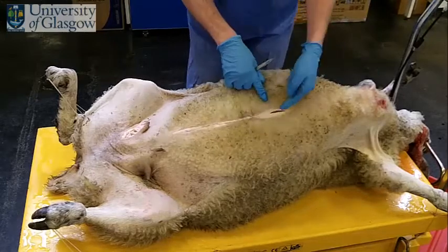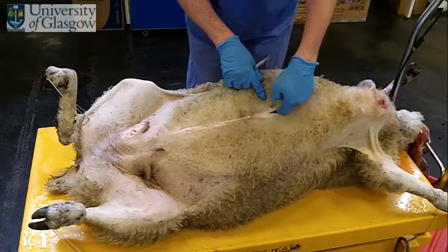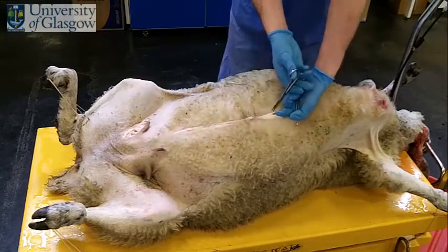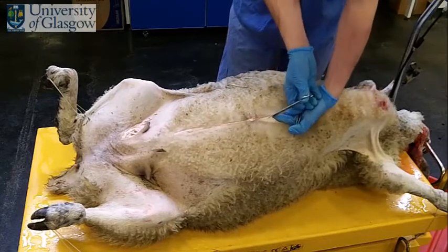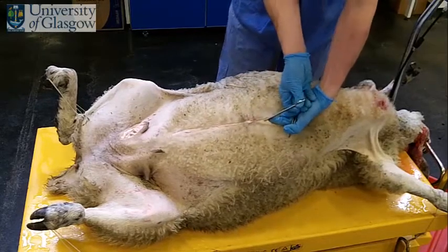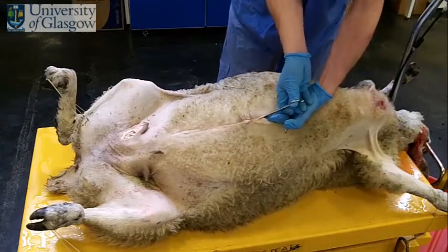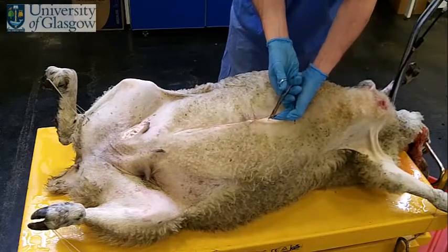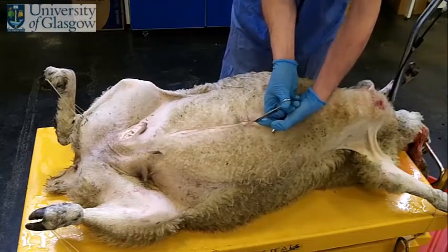I'm now going to cut through the main body wall, so I'm introducing my finger into the peritoneal cavity, and I'm then cutting through the muscular wall using these scissors. I'm coming down towards the umbilicus here, going from cranial to caudal.